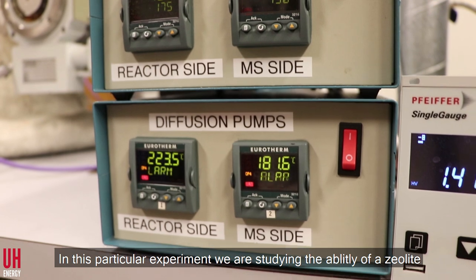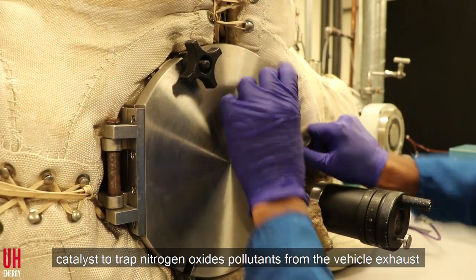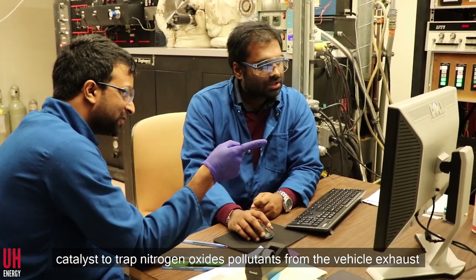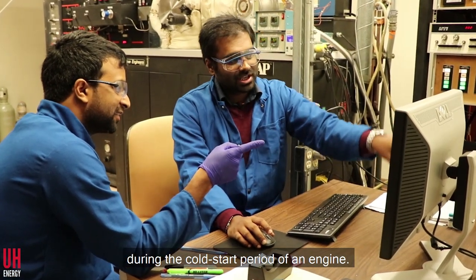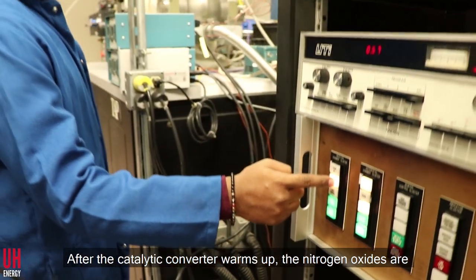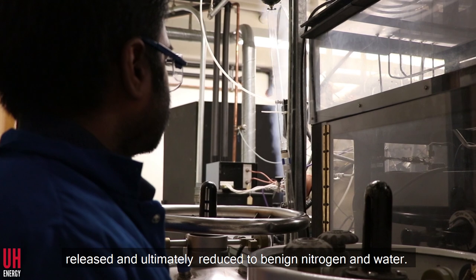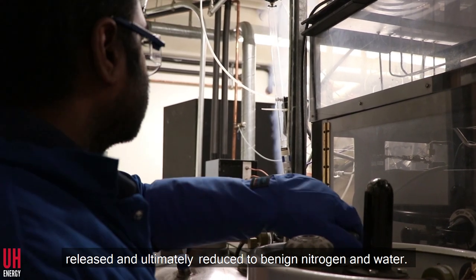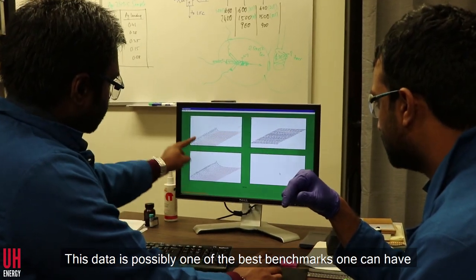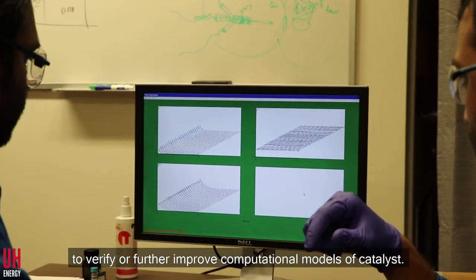In this particular experiment, we are studying the ability of a zeolite catalyst to trap nitrogen oxides pollutants from the vehicle exhaust during the cold start period of an engine. After the catalytic converter warms up, the nitrogen oxides are released and ultimately reduced to benign nitrogen and water. This data is possibly one of the best benchmarks one can have to verify or further improve computational models of catalysts.